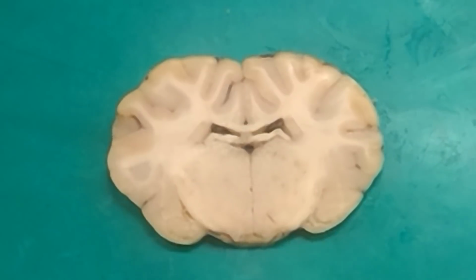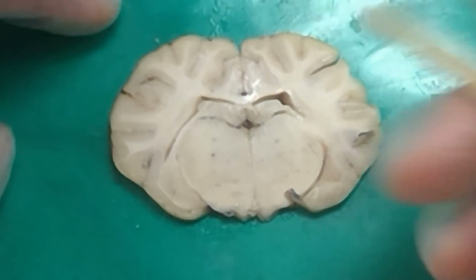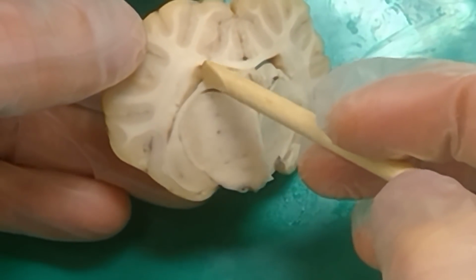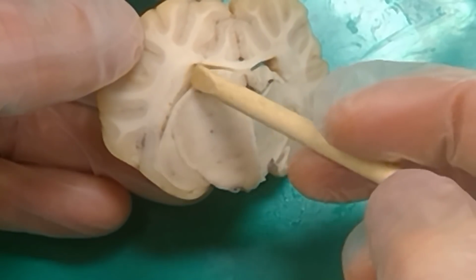How would you ask about fimbria? It would be like, name these fibers, and it would probably be something where we can more clearly see, like this kind of cut right here. Or we do something more like this cut where you can see these fibers right here. These fibers that are connecting this top part of the hippocampus and the bottom part, that's the fimbria right there.